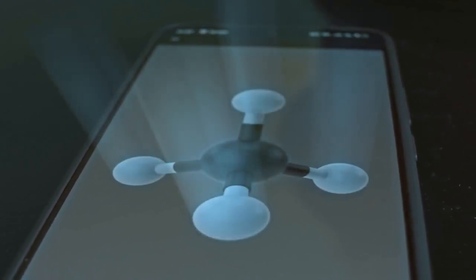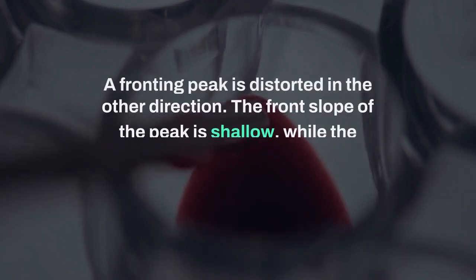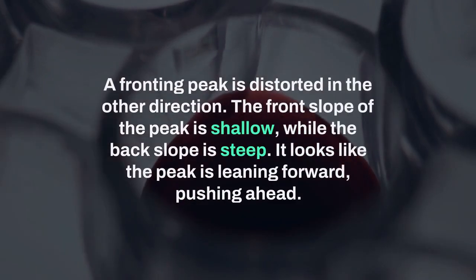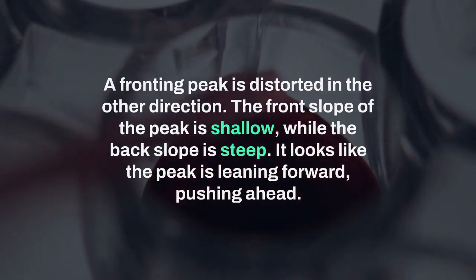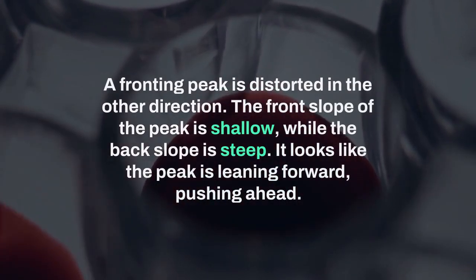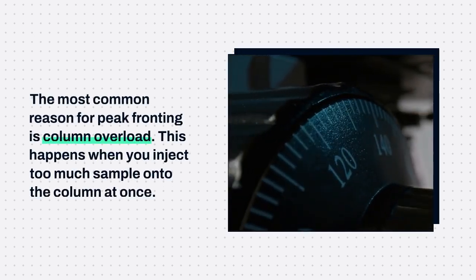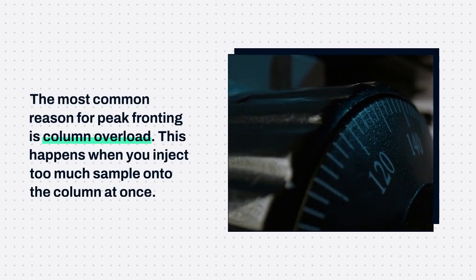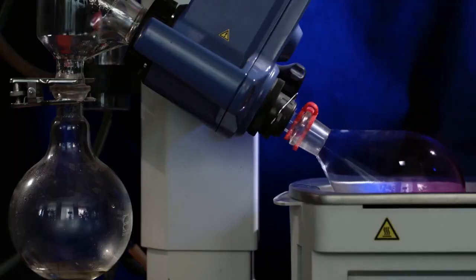Now, let's discuss the opposite problem, which is peak fronting. A fronting peak is distorted in the other direction. The front slope of the peak is shallow, while the back slope is steep. It looks like the peak is leaning forward, pushing ahead. The most common reason for peak fronting is column overload. This happens when you inject too much sample onto the column at once. The stationary phase becomes saturated, and it simply can't handle the high concentration of the analyte.